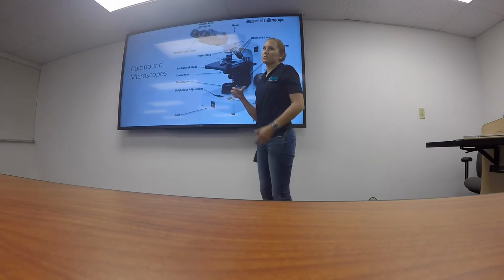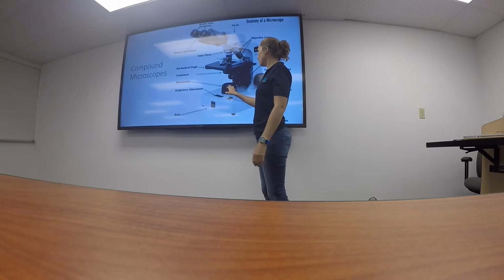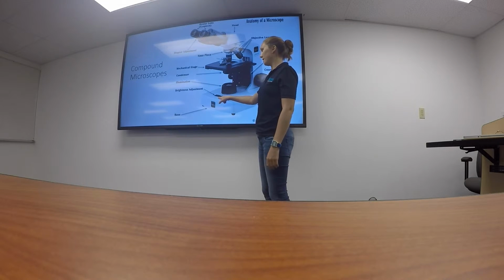We have our condenser and our illumination, which kind of play into each other. Our condenser allows us to let light in. Our illumination is our light source, and we can adjust the brightness with that.